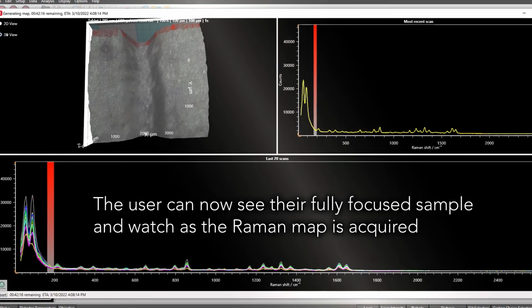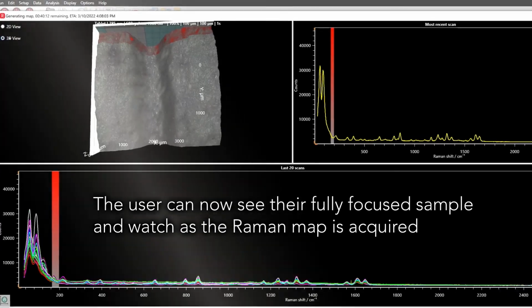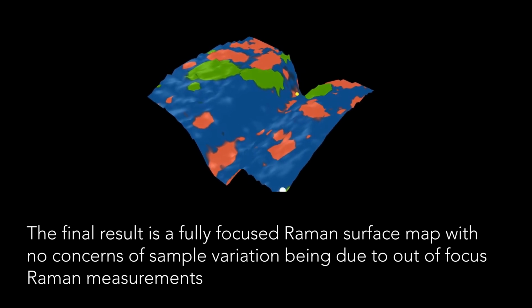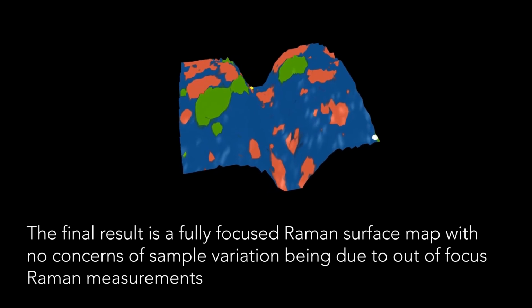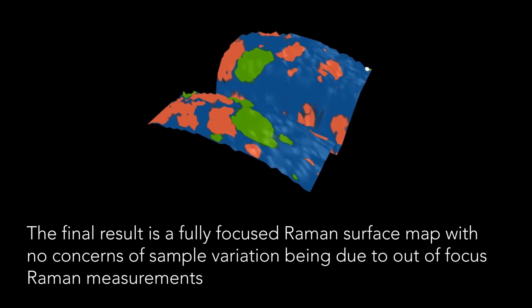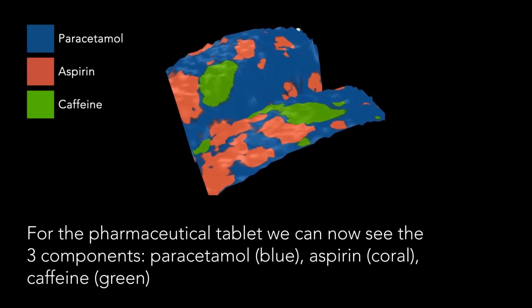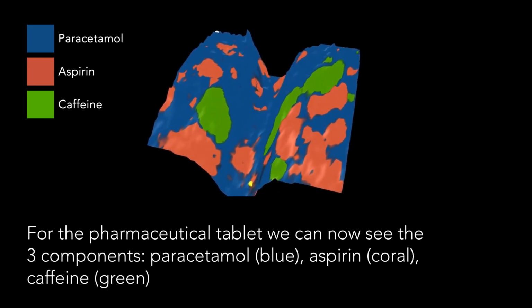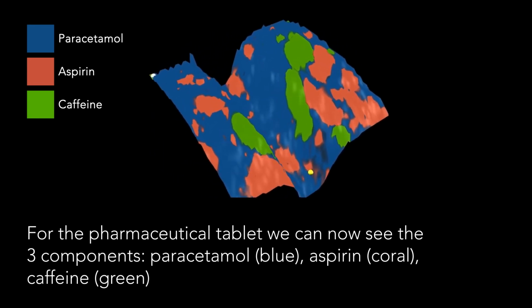They can clearly observe that the sample is perfectly in focus, and all their Raman spectra will be taken at the correct Z point. We now have the final result, a fully focused Raman surface map, where the user can be confident that any spectral differences are due to true sample variation and not out of focus Raman measurements. For this sample, we can clearly see the shape of the surface, and the three components of the tablet are well resolved. We have paracetamol in blue, aspirin in coral, and caffeine is shown in green.